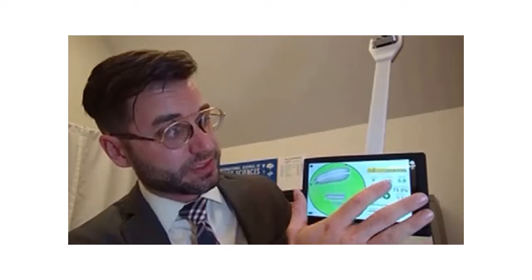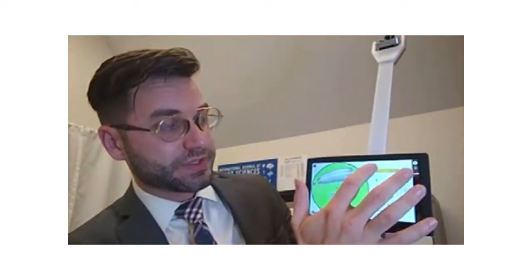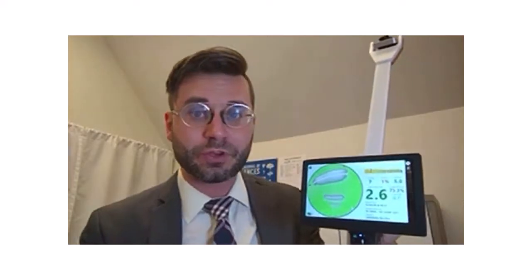And as I said, as you're looking at the data points, say for example some PAR sensors are getting a lot more light than others. You can designate and find out what's being overloaded, where you should adjust contrast, and it's really easy actually as you start working with it to figure all that out.